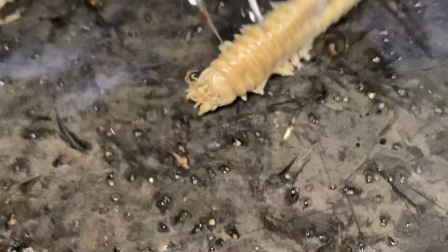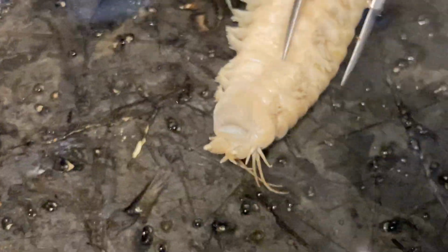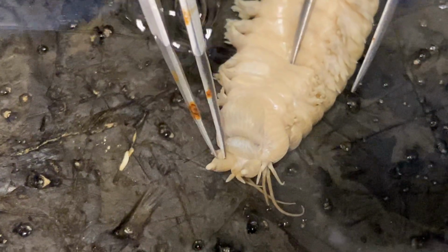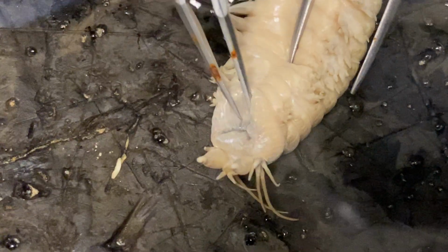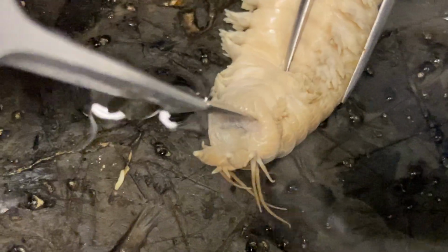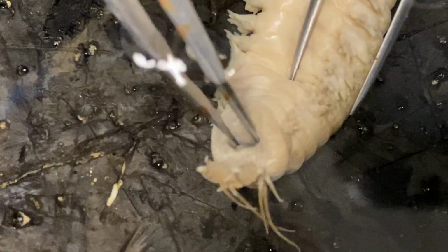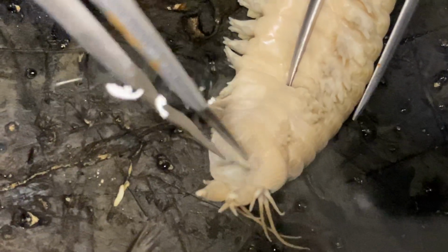Before we move on, we're going to turn this annelid over to its ventral side. Here we can get a different view of these appendages. Again, palps right here, and then our little antennae. This would be the mouth. The mouth of the worm leads into the pharynx, which is very muscular in this worm. And if I just peel back the mouth a little bit, you can see maybe a darkening in there. That would be where the jaws are. We'll get to those when we dissect the worm open.